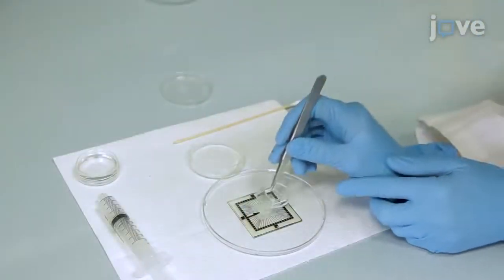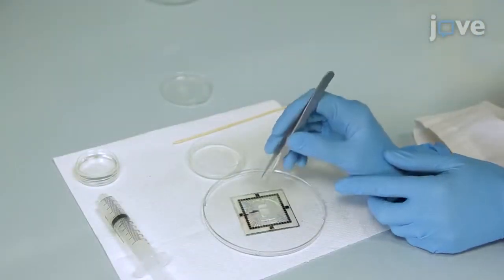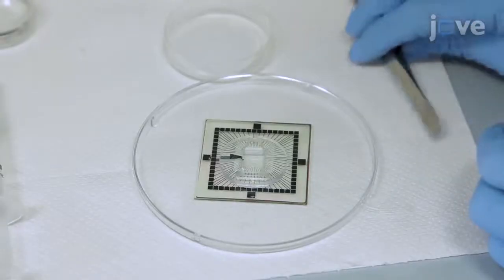Next, mount the recording chamber onto the MEA with the help of tweezers and apply gentle pressure.